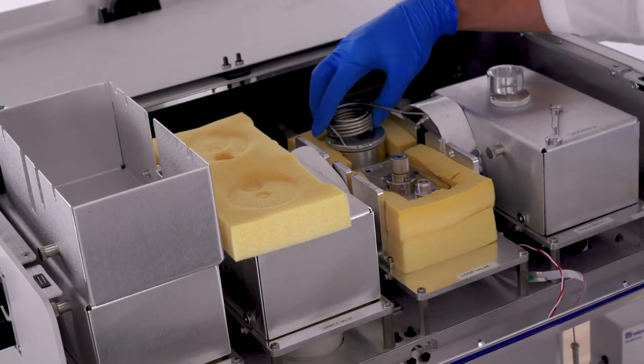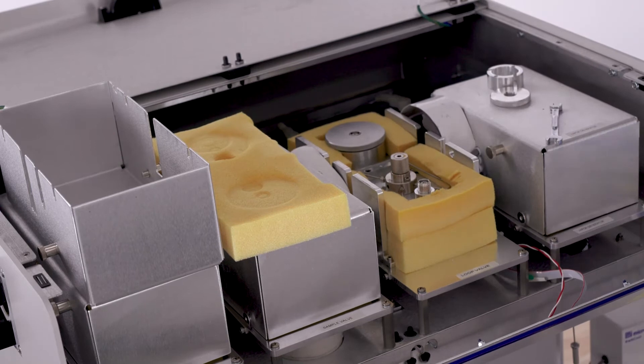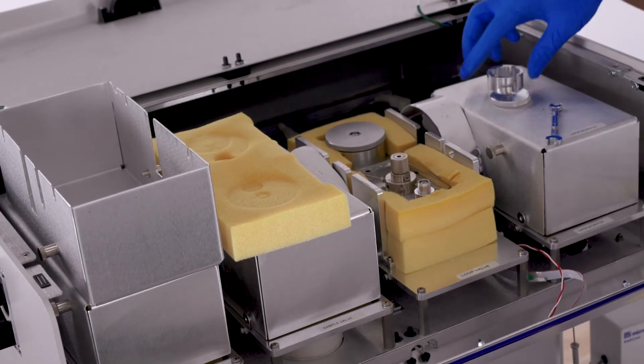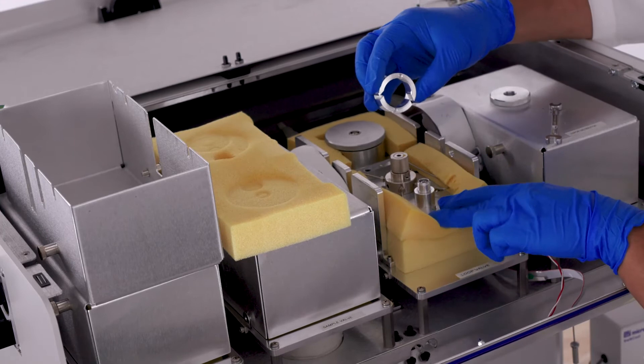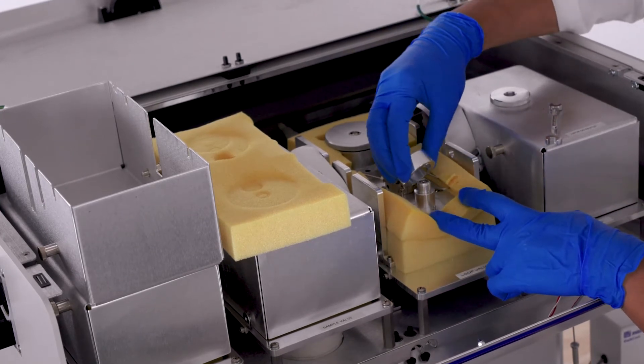Locate the correct enclosure for the new injection loop. Reassemble the enclosure ring and top nut if a different enclosure is needed. Be sure to align the holes on the enclosure ring to the pins below it.